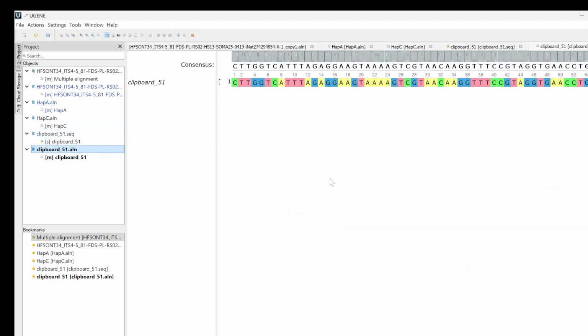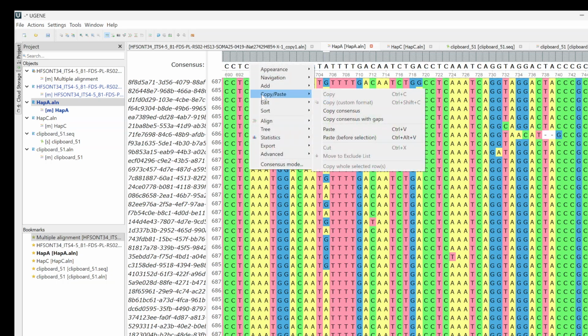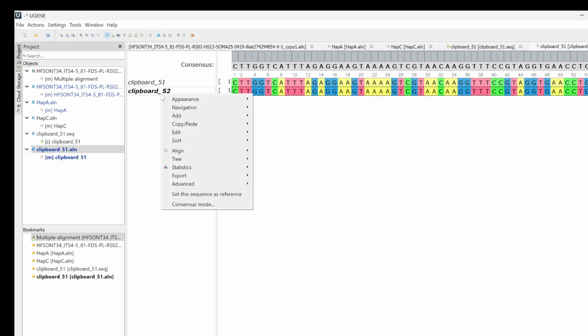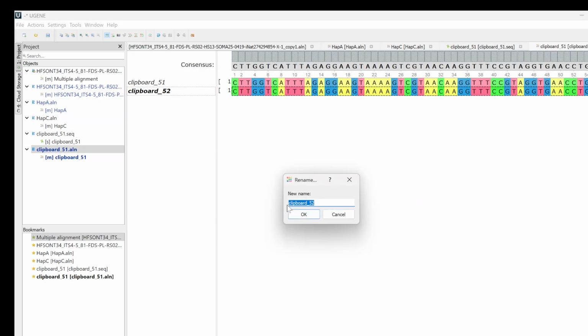Cool. So now we have what I guess we would call haplotype B, since I foolishly named this one A, is on the top here. I'm going to go in here and I'm going to copy the consensus. And I'm going to go into this and paste it. So clipboard 52 is haplotype B. Wonder if I can rename it? Add sequence name. Yeah. That makes my life infinitely easier. That's hap. Okay.